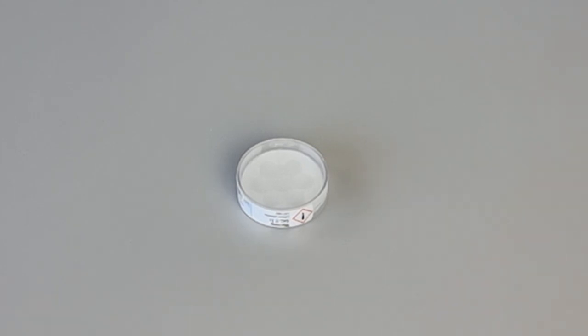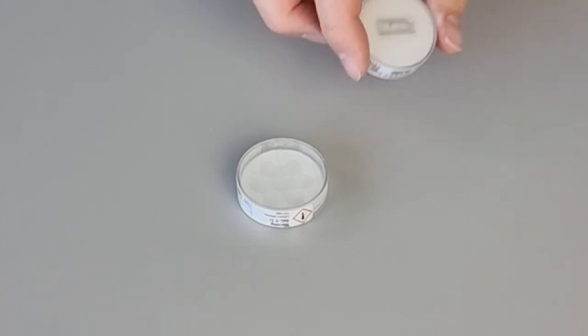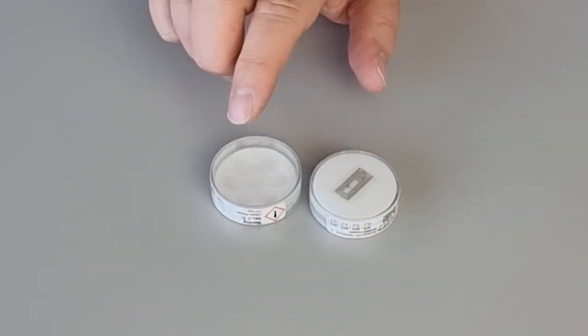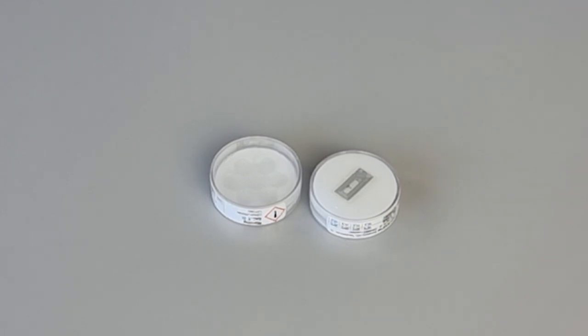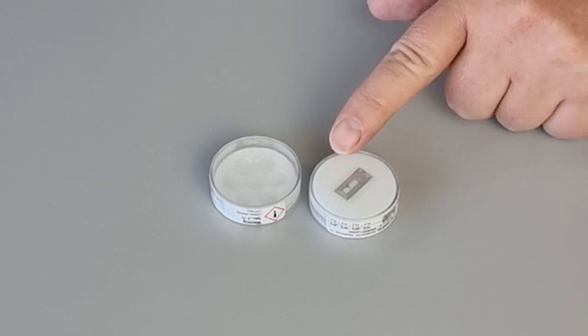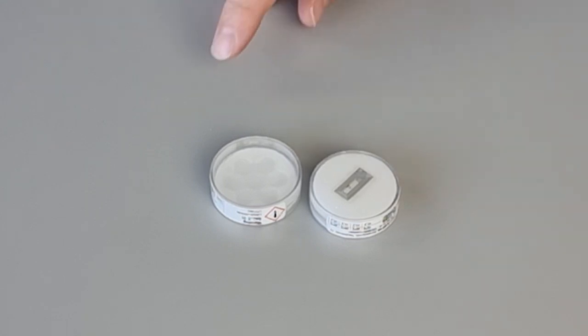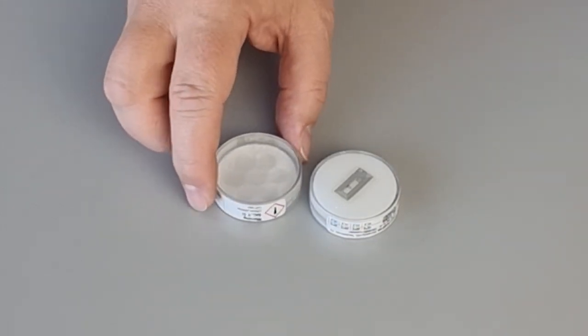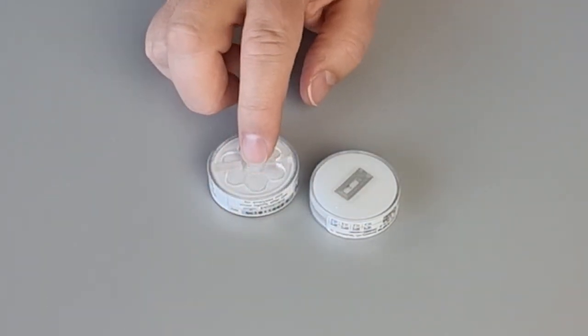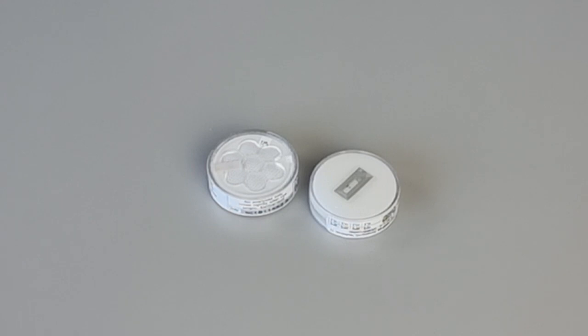Notice that there are no salt crystals in the standard. If we compare it to a good standard, and the reason this doesn't have an RFID chip on the bottom like this one is because it's been taken off for examples, you'll notice in the good standard, you can see the salt crystals, while in the standard that's been left out, there's just liquid inside of there. And in fact, if you look at the surface, it's actually puffed up here on the top because it's filling up with so much water after having been exposed to room humidity.